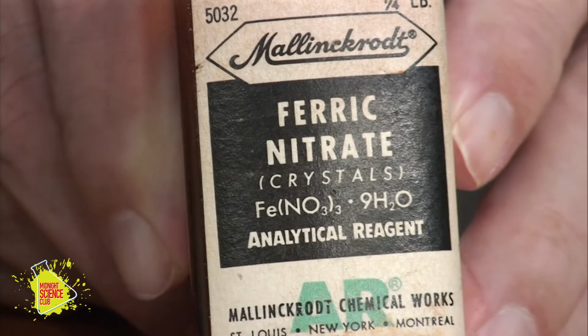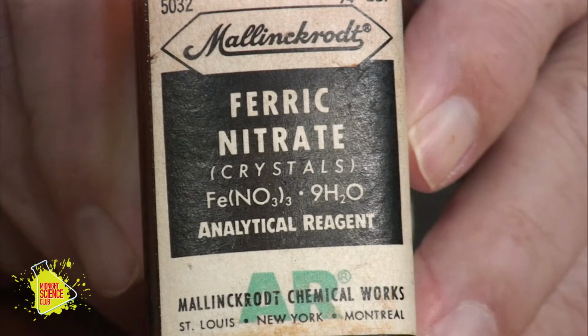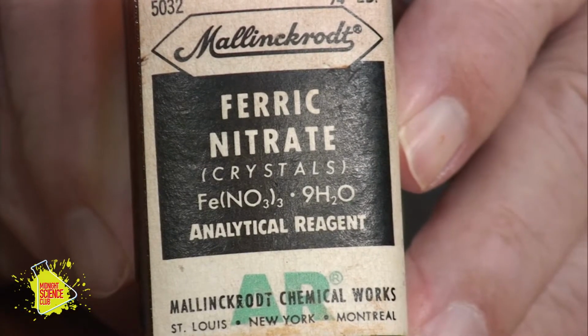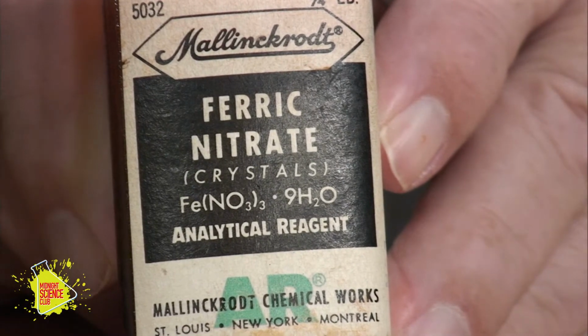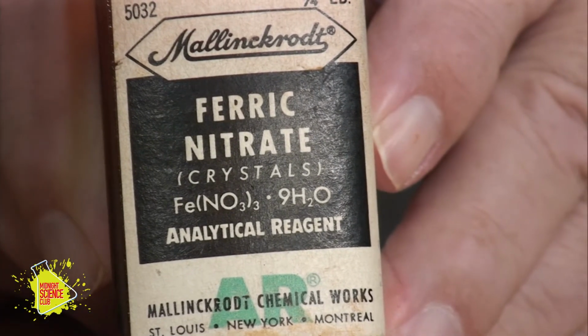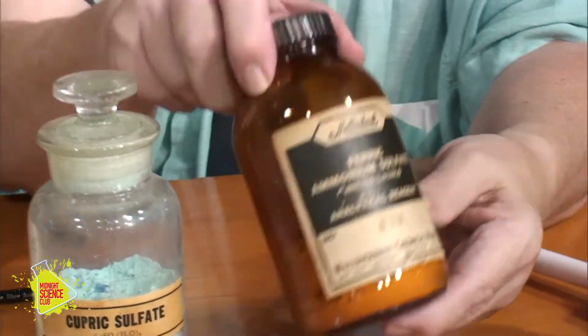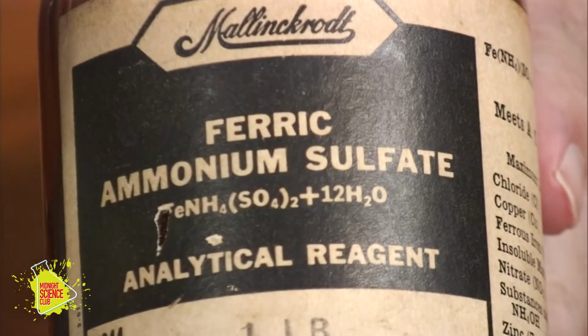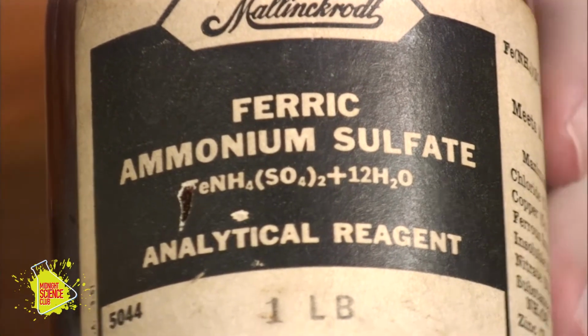And let's just look at some reagents right here. Here's one. Ferric nitrate. There's the iron, Fe, the nitrate, NO3, and there's 3 of those. But look at that. Dot, 9 H2Os. So that's hydrated. It's got 9 water molecules attached to it. And let's check out another one here. Ferric ammonium sulfate. Look at this one. See if you get that. It's got 12 waters of hydration. This is a hydrated chemical.